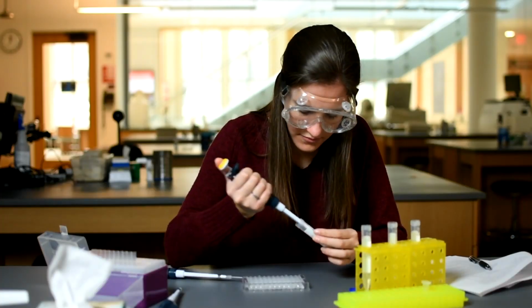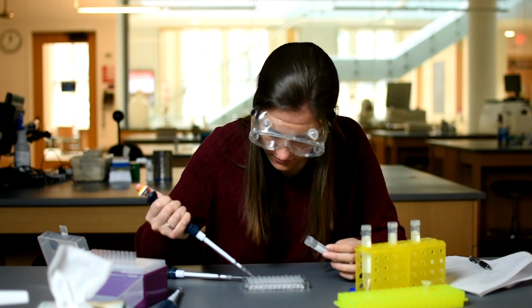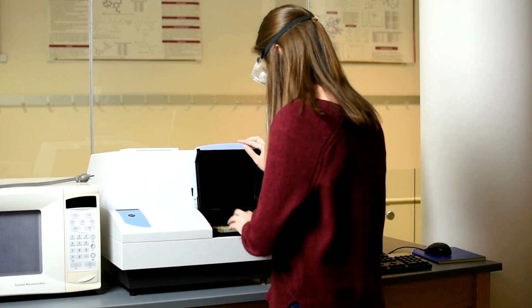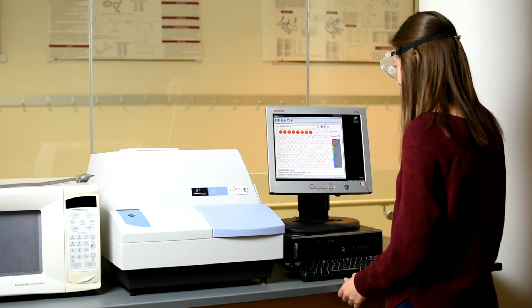We are interested in finding competitive inhibitors to enzymes, and we do that using a two-pronged approach. The first of those, as is demonstrated by Grace here in the laboratory, is looking for molecules with the enzymes and the substrates in lab. We work in very small volumes with 96 well plates, and using a microtiter plate reader, we can actively test several molecules in one experiment, several in one afternoon.